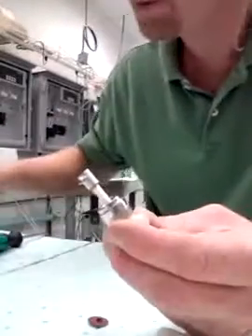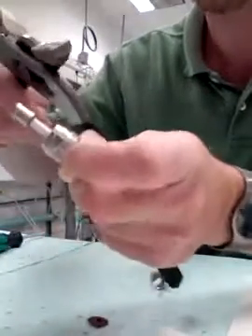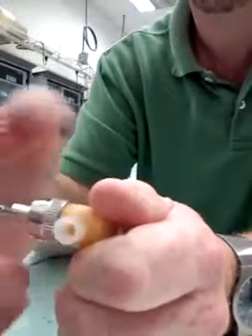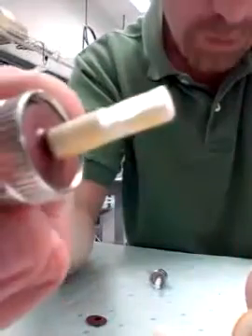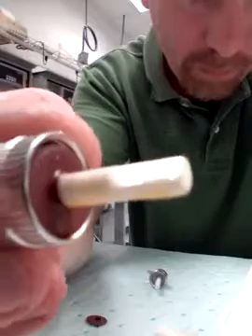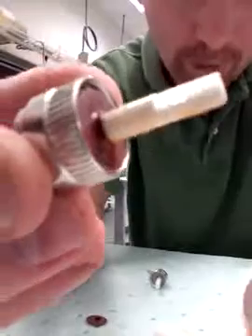The next thing is to grab some channel lock pliers. This unscrews counterclockwise. Pull that out — this looks actually fairly dirty. If you're pulling this off and haven't flushed the pump free of reagent, you might find some leftover reagent in there, so you should be wearing gloves.